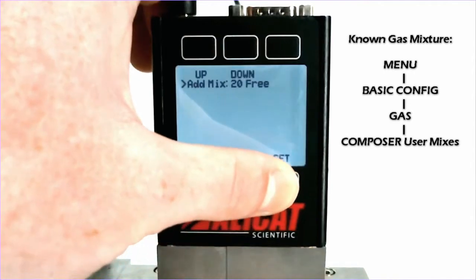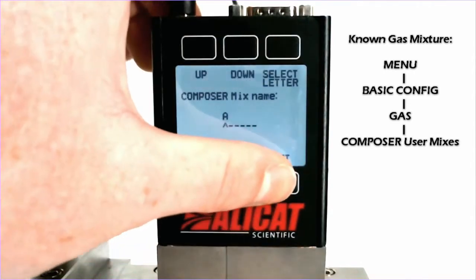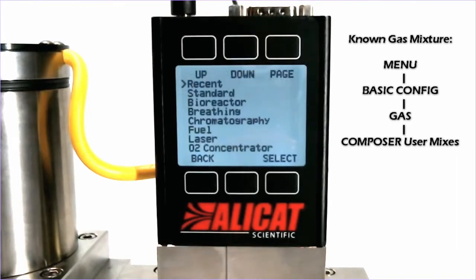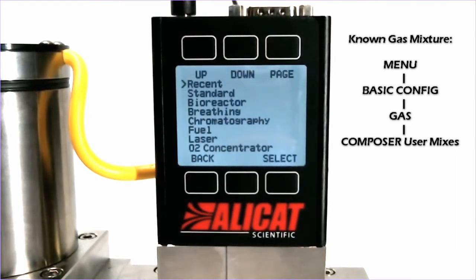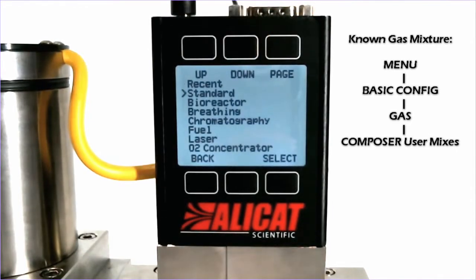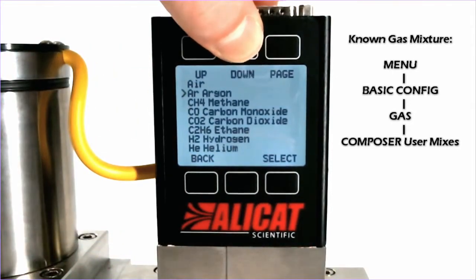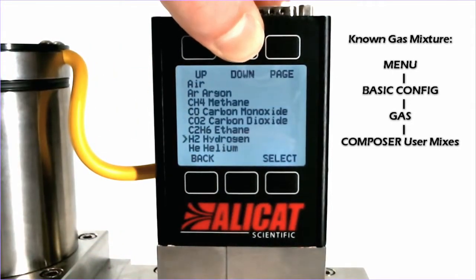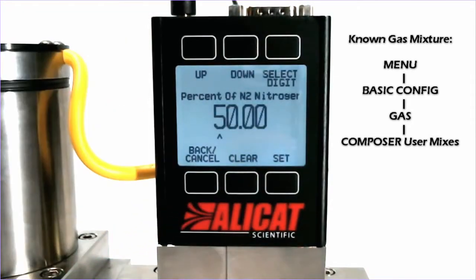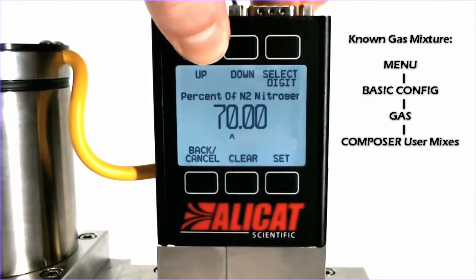We will add a new mix, just name it A for now, and we will add our first gas. Say we are looking to replicate atmospheric air. First, we will add our Nitrogen, scroll down until we find Nitrogen — there we go — and set that at 78%.